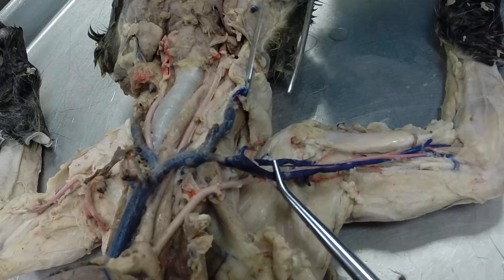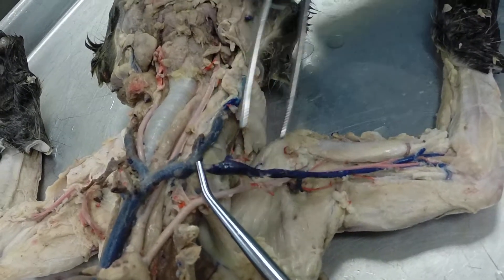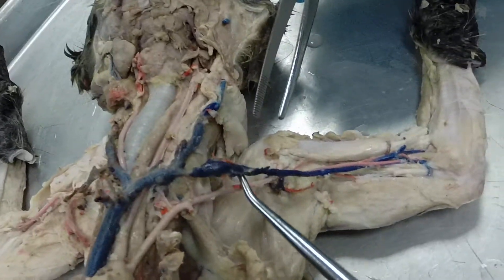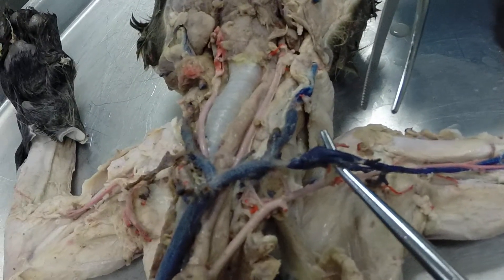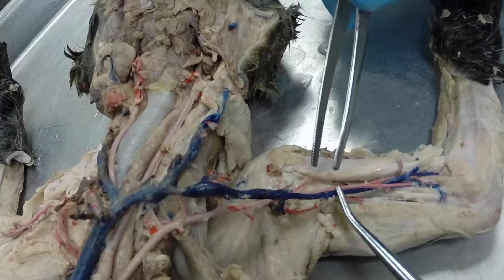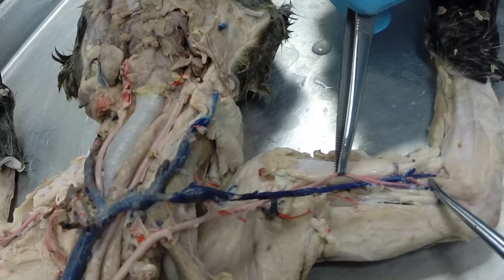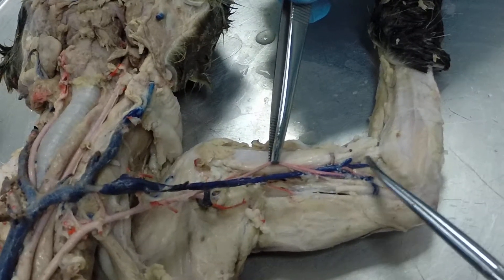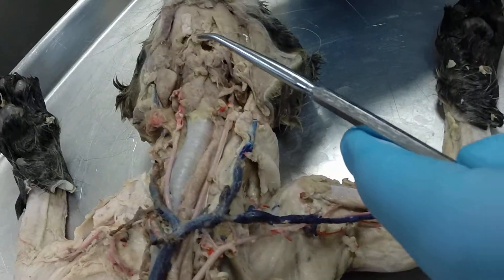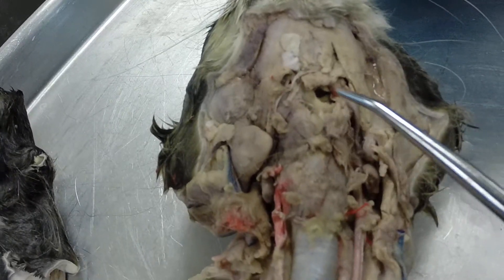The left subclavian is called that between the branching points, and it branches into the left subscapular vein and the left axillary vein. The left axillary vein continues out across the arm, at which point we call it the left brachial vein. And where it turns at the elbow we call it the left median cubital vein. We're also supposed to have the transverse jugular going across here, but in this cat it's missing.